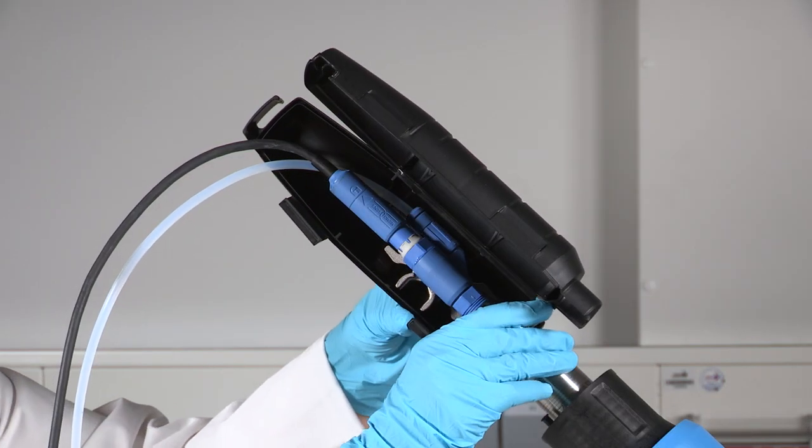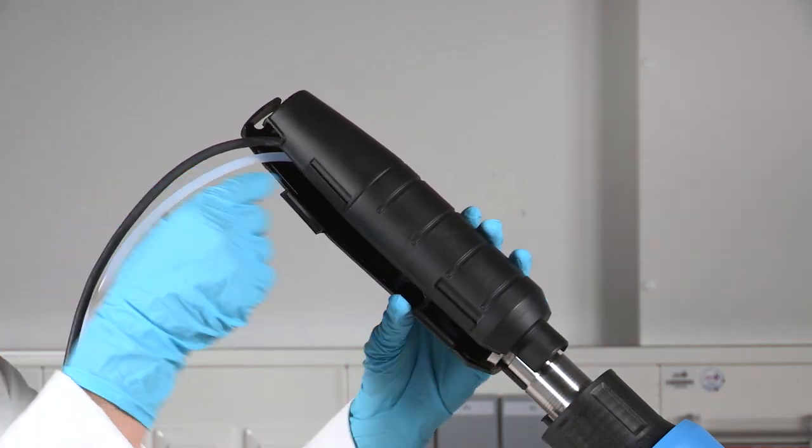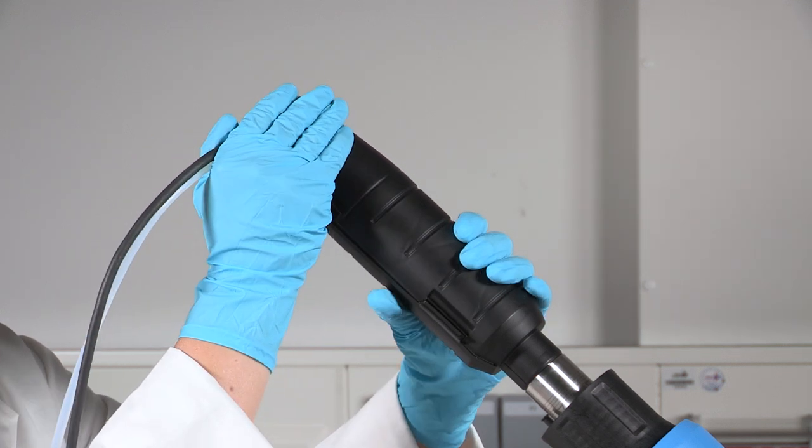Guide the KCL hose through this hole during installation of the cover.